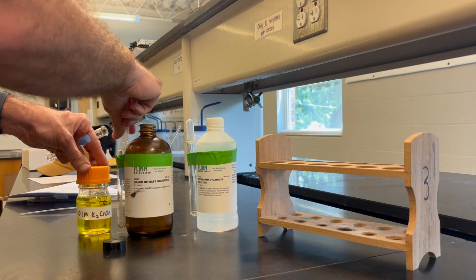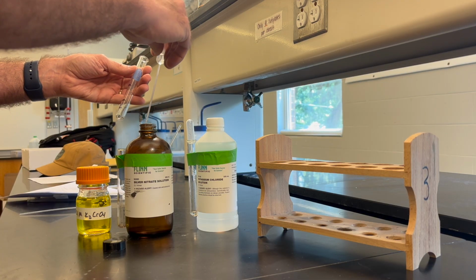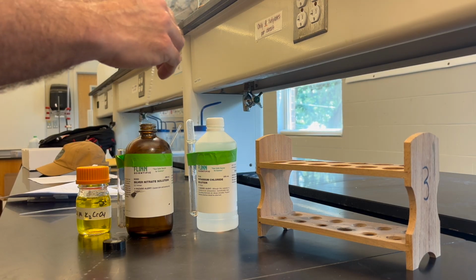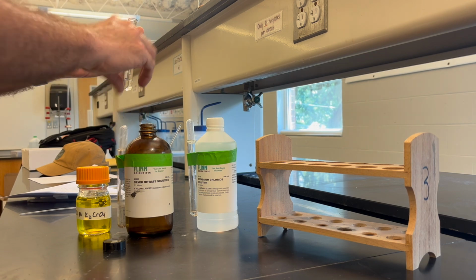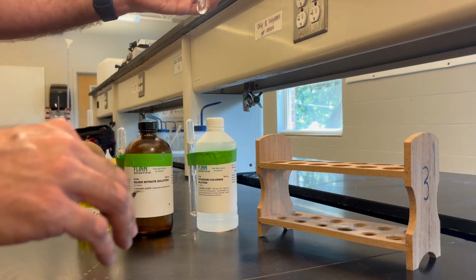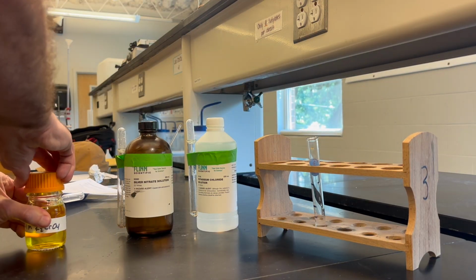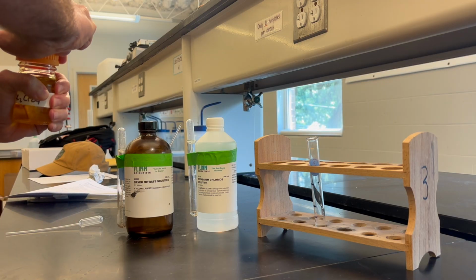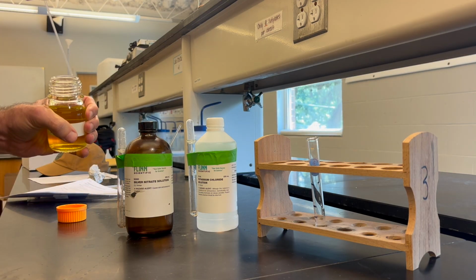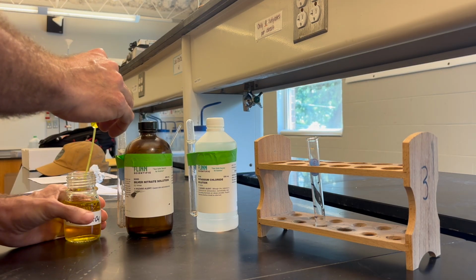And then to that, we are going to add 0.1 molar potassium chromate solution. And students are to take note of the color of each of the solutions. And the markings that I put on there are simply for speed. You don't have to do that. You can have the students measure 2 milliliters of each of those solutions. Since the volumes don't have to be precise, it's a qualitative lab rather than a quantitative lab. The measurements don't have to be precise.